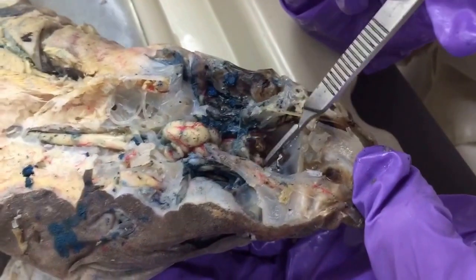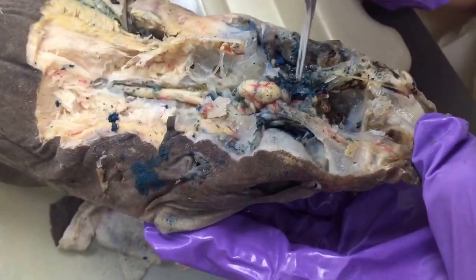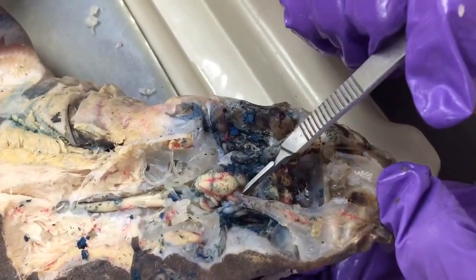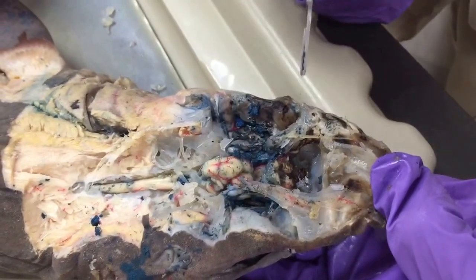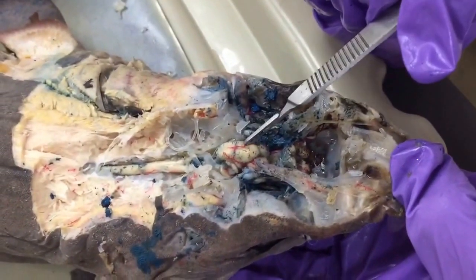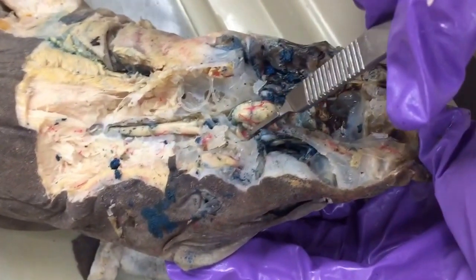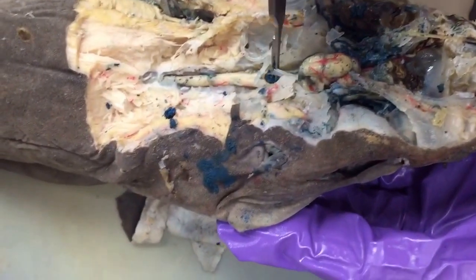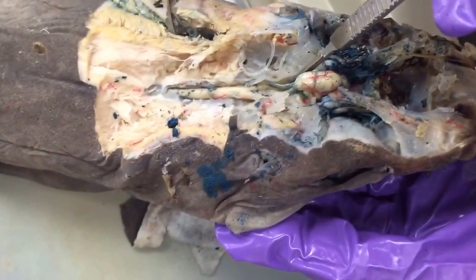Okay, so from our cerebral hemispheres here, just behind that, this section is the epithalamus. Then we have two optic lobes. Then we have our cerebellum. So our cerebellum has three main parts: the anterior lobes here, the posterior lobes here, and then on either side, these kind of ear-shaped structures called auricles. Okay, posterior to the cerebellum, we have an even older part of the brain called the medulla oblongata.